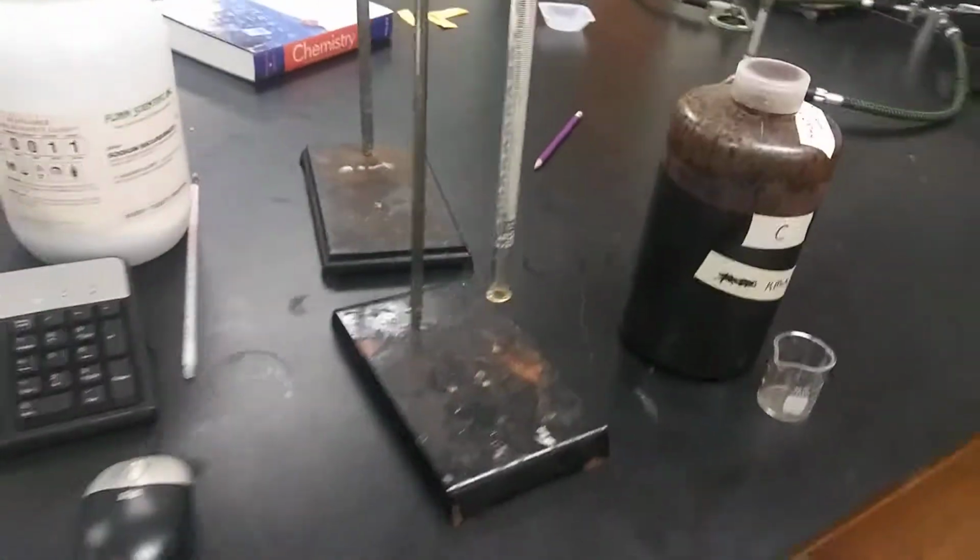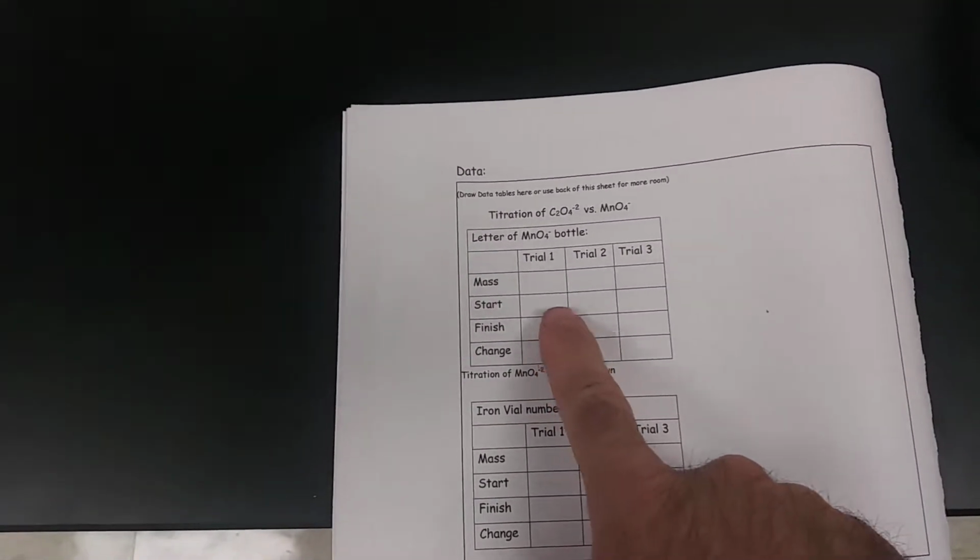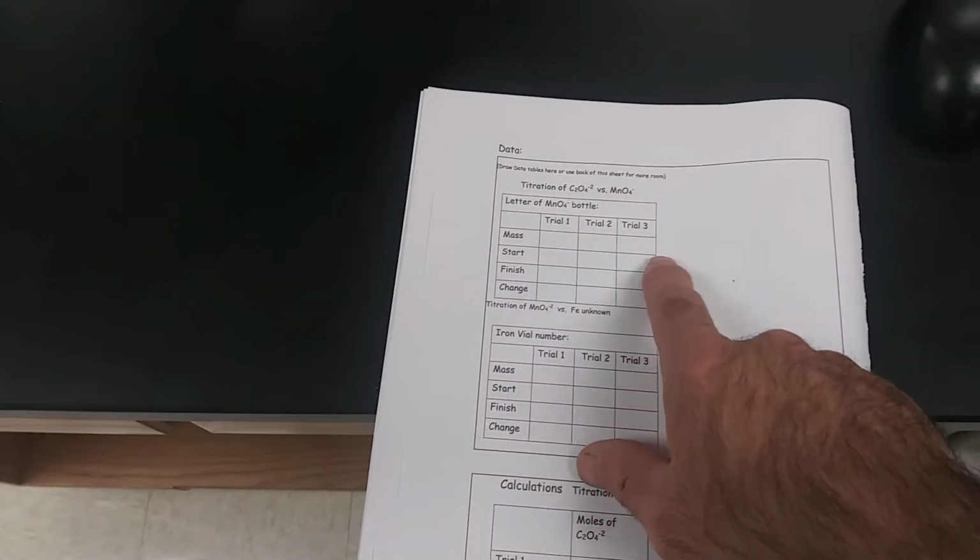Also, one more thing about the titration. You have in your workbook a data table. One small thing we're trying to avoid, this just happens to be our current version. It changes all the time, but you'll note that we have lots of stuff here. I got trial 1, trial 2, trial 3, the masses. We really want to avoid going to the scale and writing a number on the tops or around places, or a kid will say, oh, my partner's got that number. That's no excuse. You have your numbers, and they have a spot where they go.